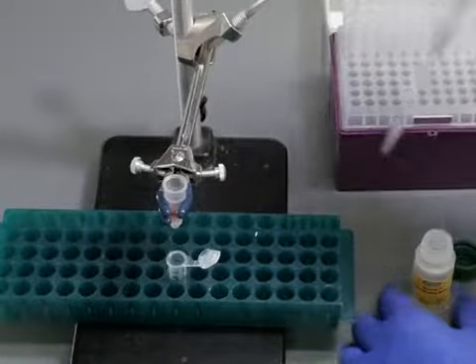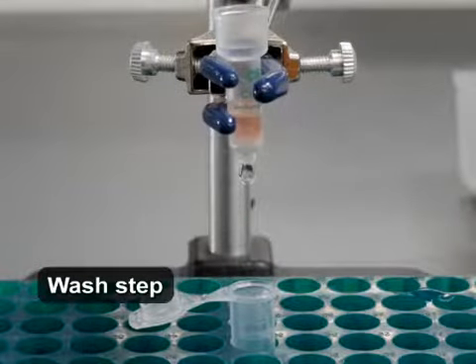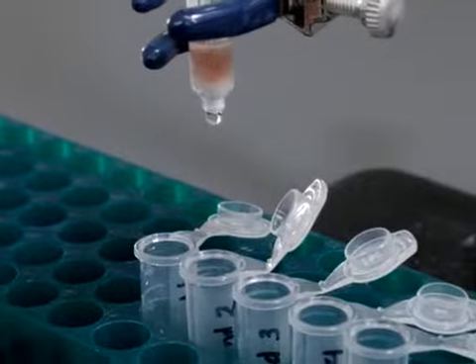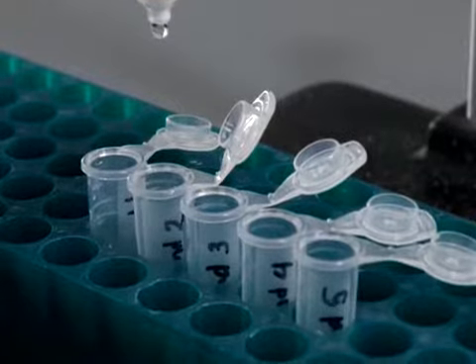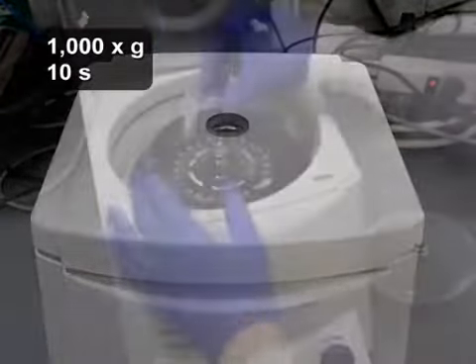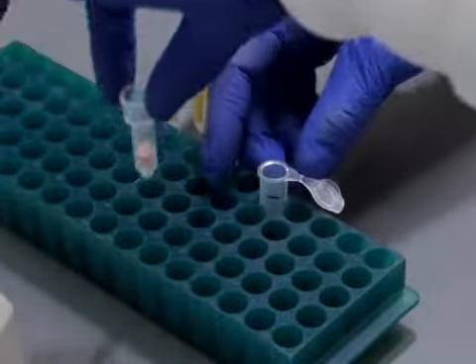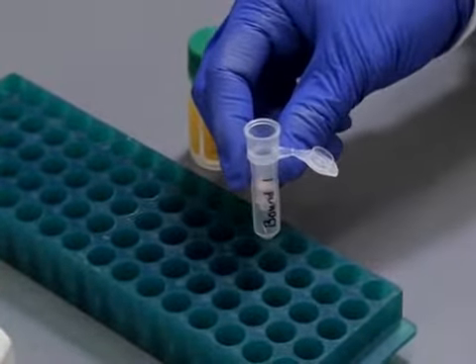Once the sample has been loaded, wash with a column volume of buffer and allow it to flow all the way through. Repeat for a total of 5 washes. Collect each wash in its own tube, labeled Unbound 1 through 5. For the last 2 washes, centrifuge the column for 10 seconds to make sure that all unbound species wash off the column. Put the column in a new 2 ml centrifuge collection tube and label it Bound 1.